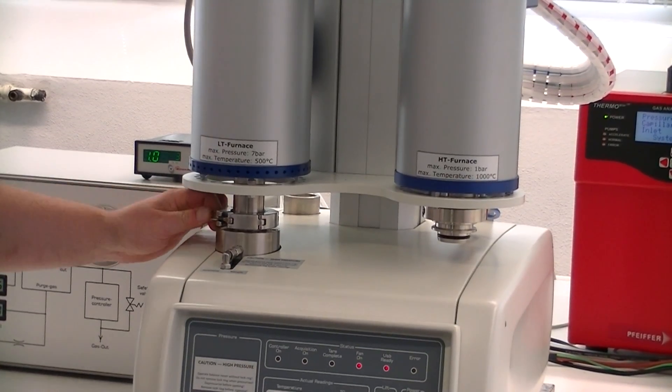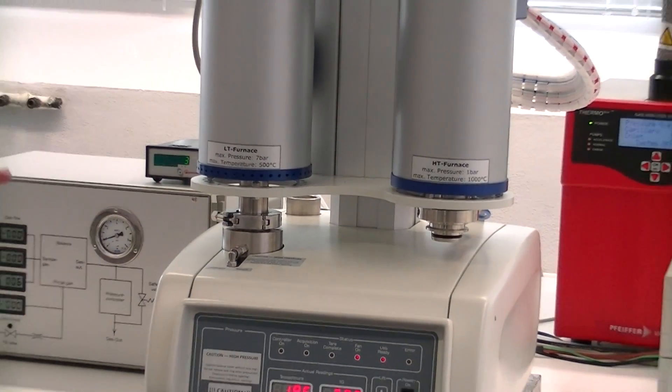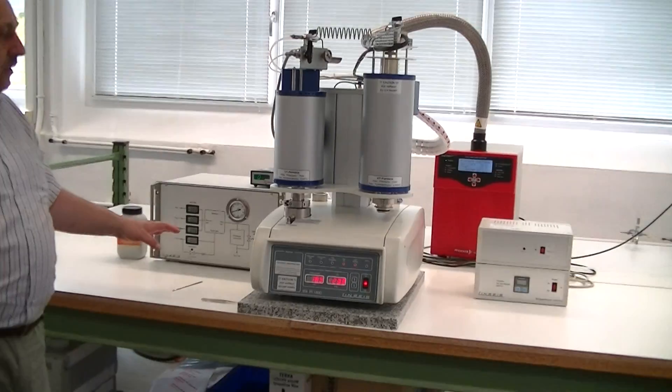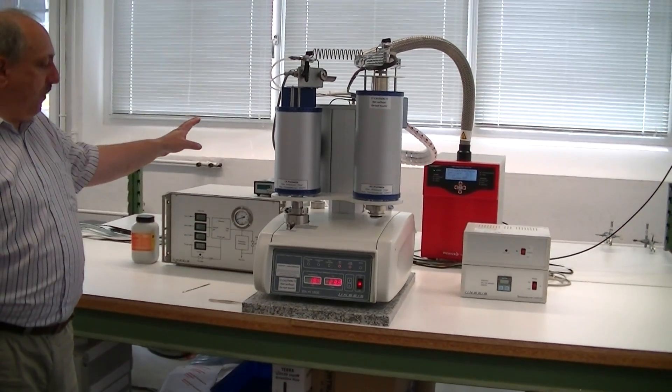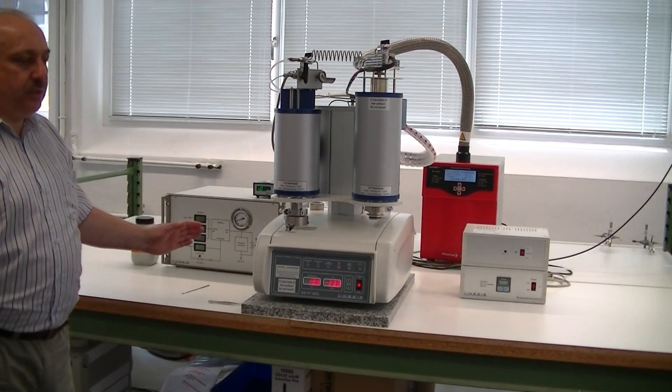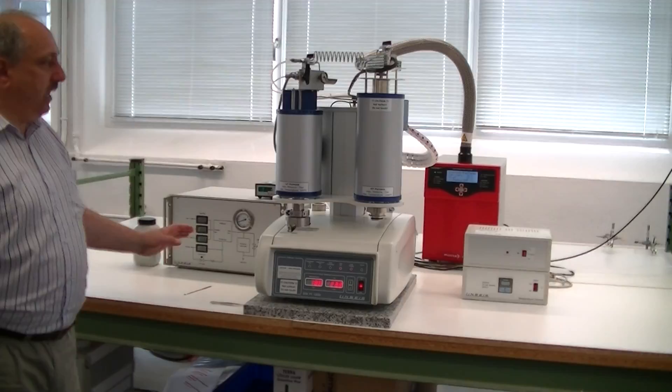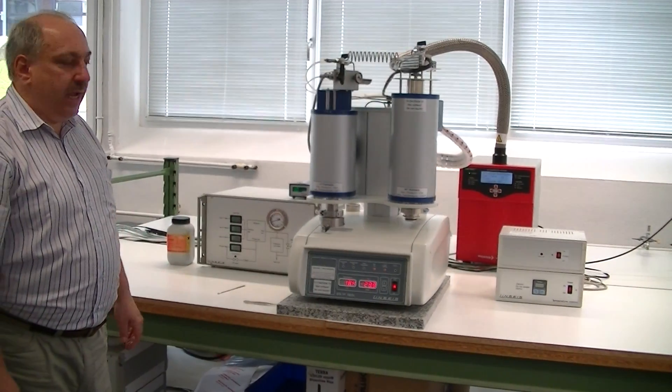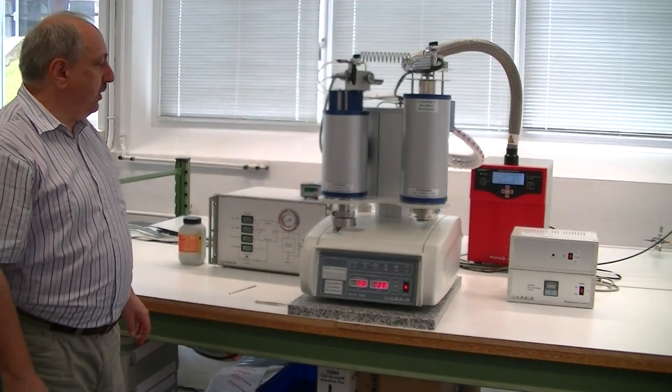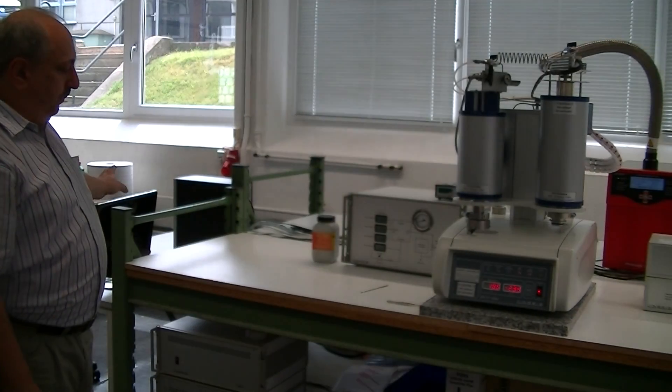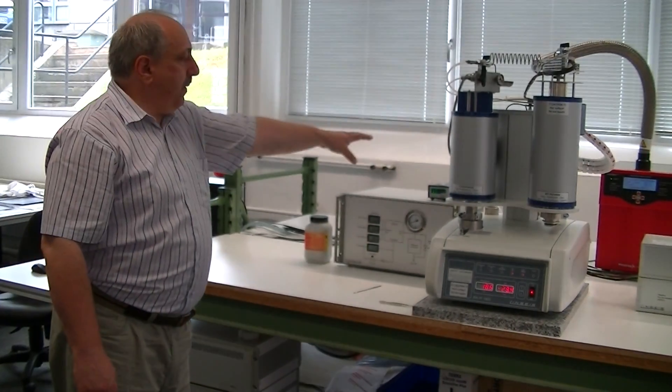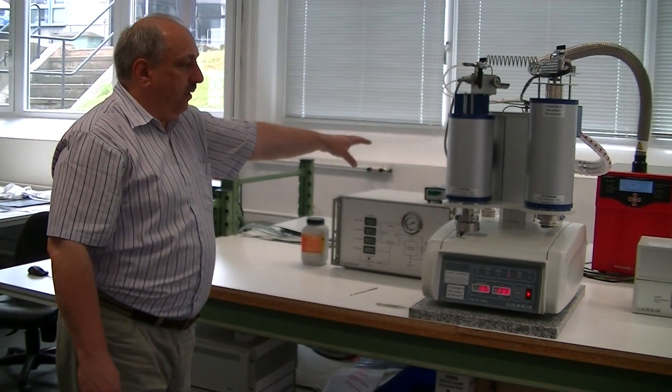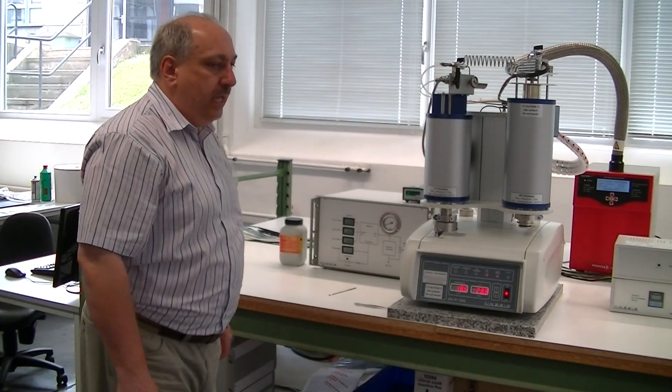After this procedure, we have to evacuate the system with the vacuum pump. And then fill the system with gas and during the experiment we can have gas operation. This can be all done from the computer or from the manual operation of the vacuum pump.